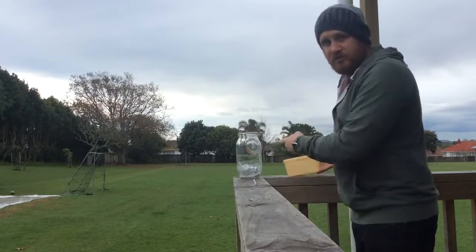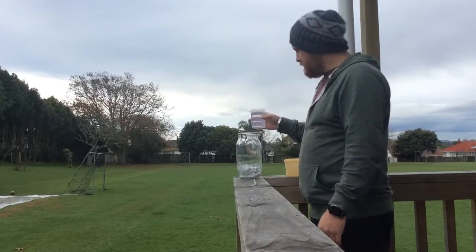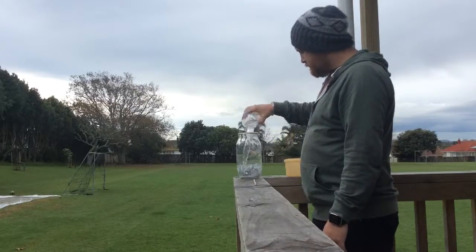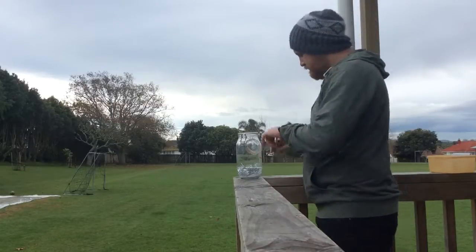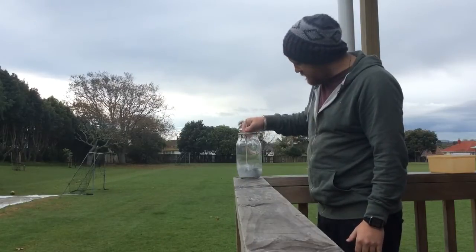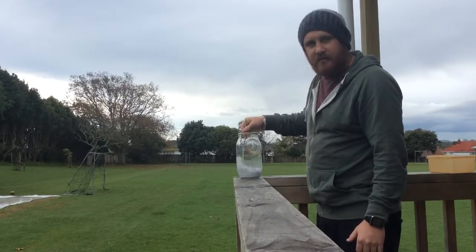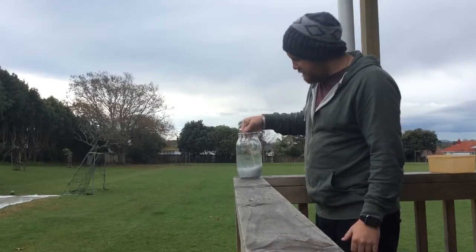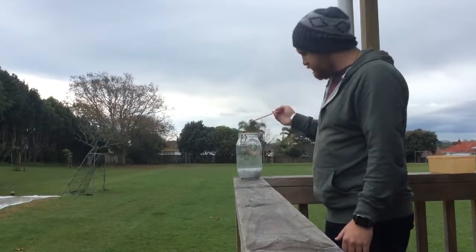Now the next thing that I just put in was aluminum foil, I should say, and then this is just plain pure water. So there's already a little bit of bubbling, but I'd say that's from the air escaping from the inside. So what I need to do now is give it a good mix, because I want that powder to start diluting and dissolving into the water so that it is able to react with the aluminum foil.